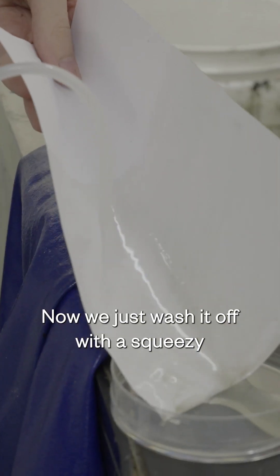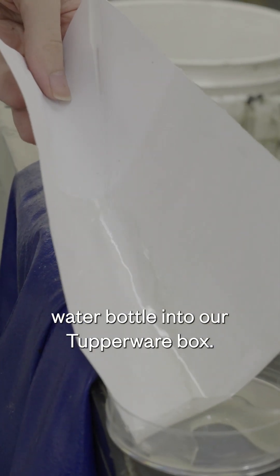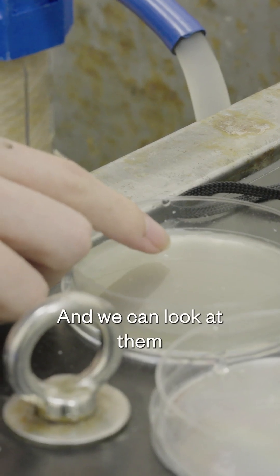Now, we just wash it off with a squeezy water bottle into our Tupperware box, and we can look at them under the microscope.